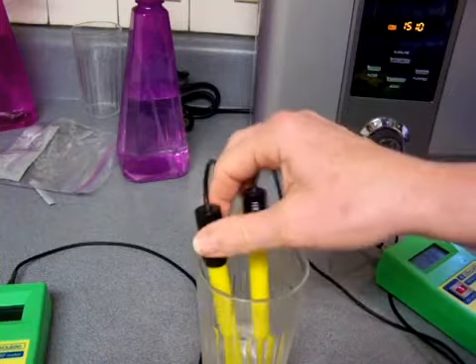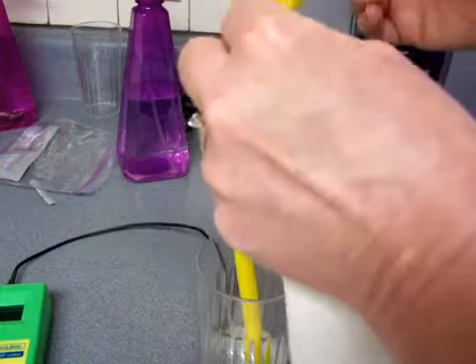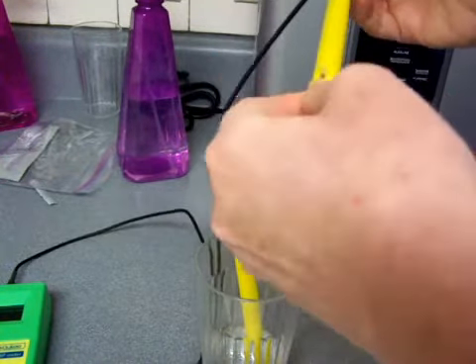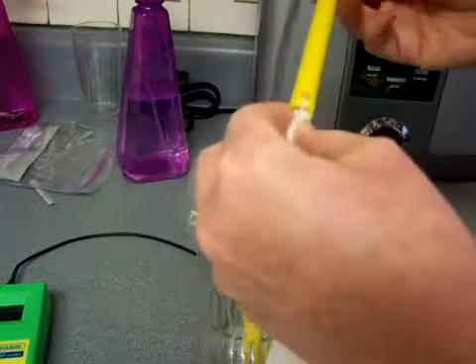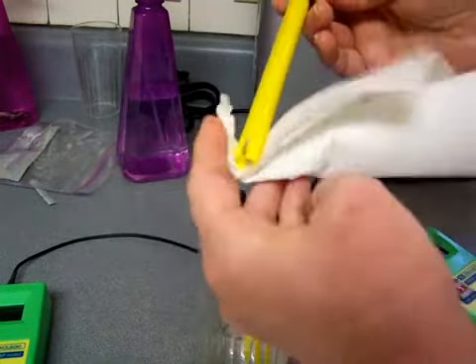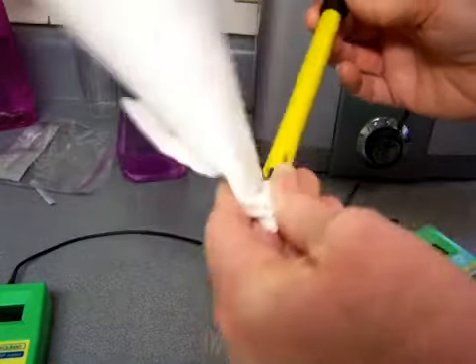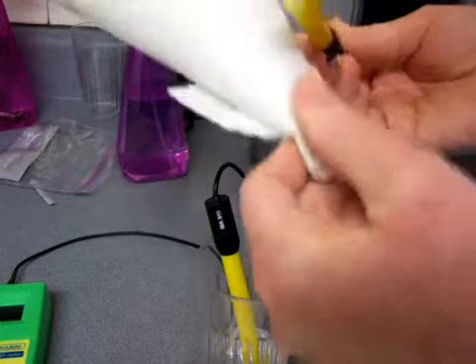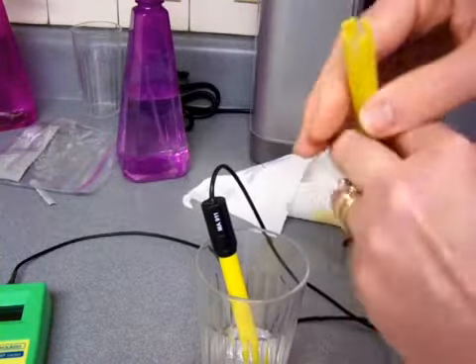Alright, here's the ORP meter probe. First I'm going to just dry it. It's been sitting in acidic water for just a minute, which will help loosen up that calcium. And then I'm going to dry it. And basically the problem with the probe and the reason why sitting in ionized water causes it to get quote-unquote dirty is it's not full of dirt, but it's just got a calcium film on that little needle that's in there. Now that's the goal of cleaning it.